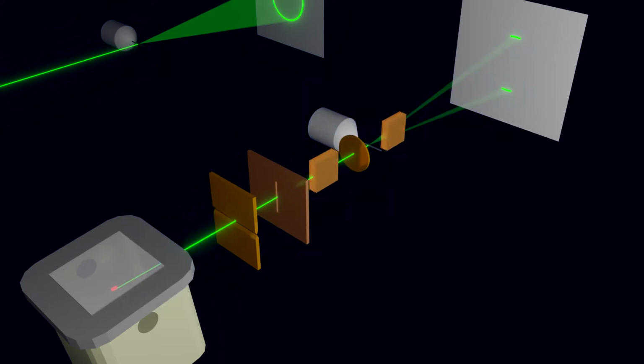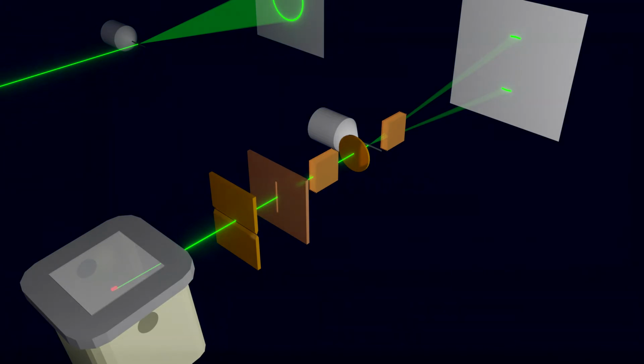This fake configuration can be used to refine datasets from synchrotron instruments with image plate detectors just fine, as we will see in a minute. There are two more things we need to change, the radiation spectrum and the goniometer radius, but I will show how to do this directly in Profex.